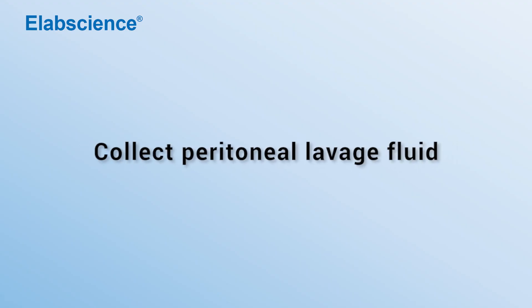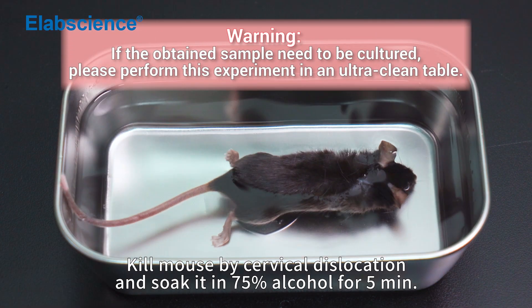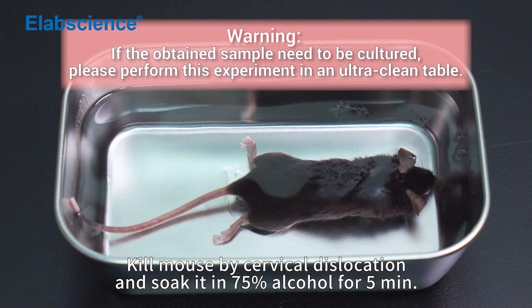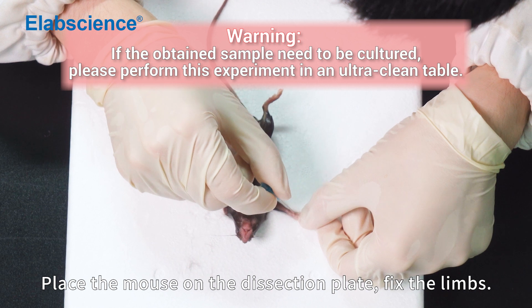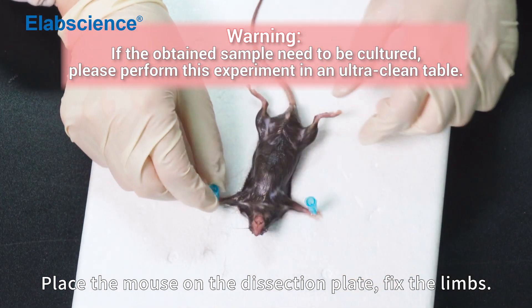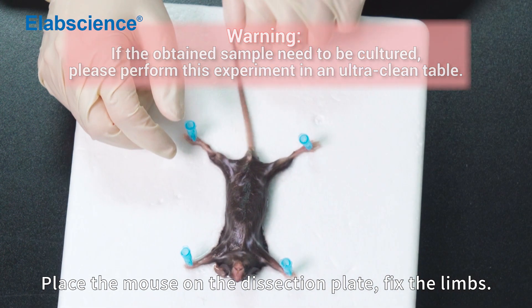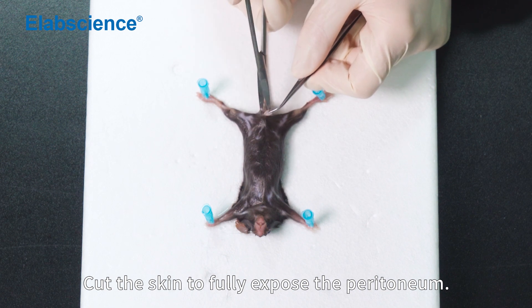Collect peritoneal lavage fluid. Kill the mouse by cervical dislocation and soak it in 75% alcohol for 5 minutes. Place the mouse on the dissection plate and fix the limbs. Cut the skin to fully expose the peritoneum.